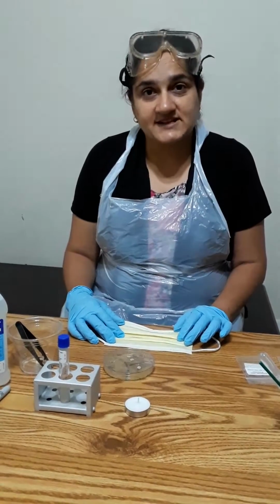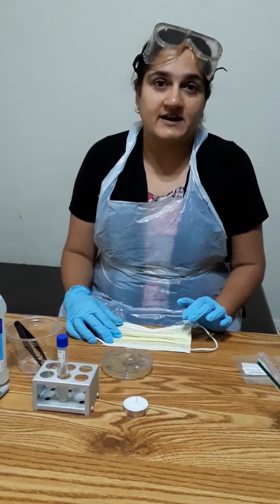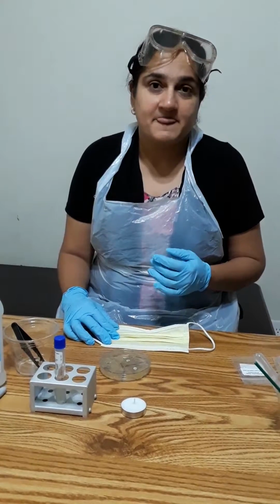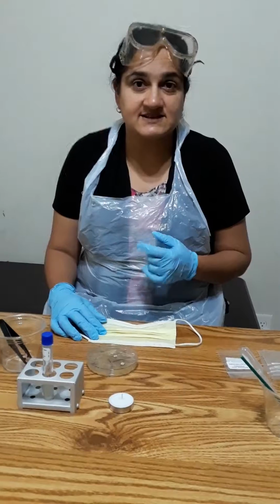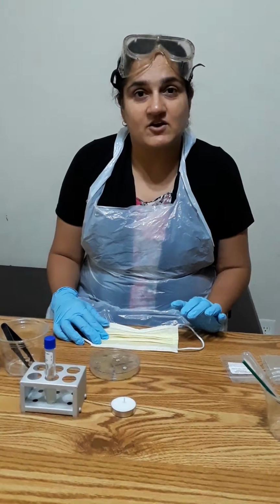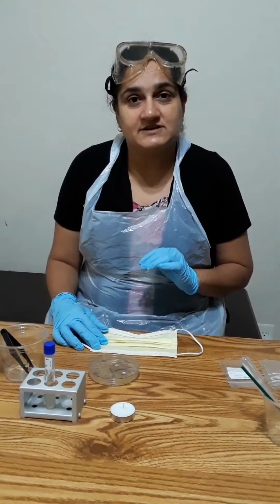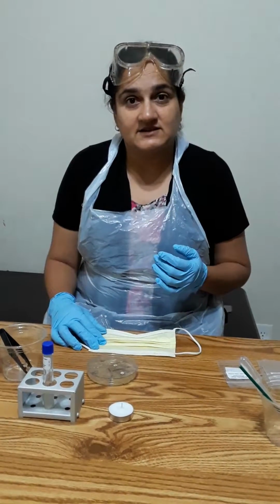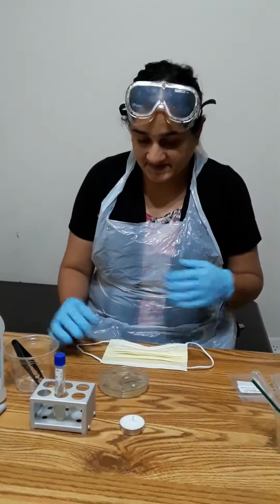In this experiment, I'm going to use the microbe S. epidermidis, that is the active culture of that, and I'm going to use 3 antibiotics: gentamicin, penicillin, and novobiocin. They are in the form of a disc, and each disc has a particular concentration of that antibiotic. They are already prepared. So I'm going to see how resistant this S. epidermidis is to these antibiotics, and how effective these antibiotics are in inhibiting the growth of these microbes.